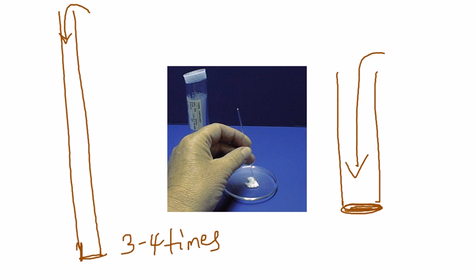The reason you want to do that is that you tighten the packing, and the amount of air present between the particles is minimal. That gives you nice uniform heating. Your readings are going to look much better, and you won't have any air interfering with your reading.